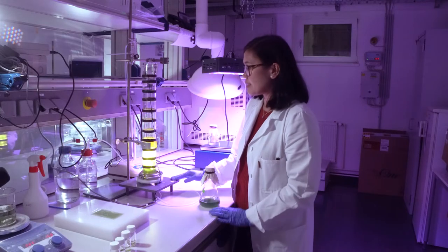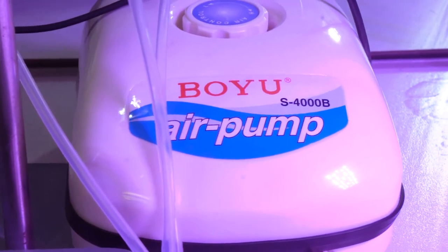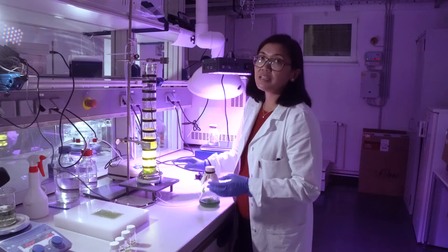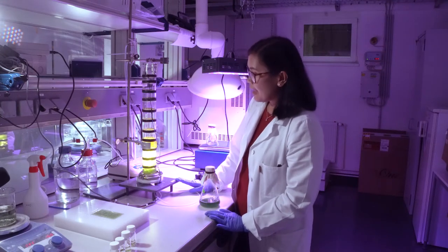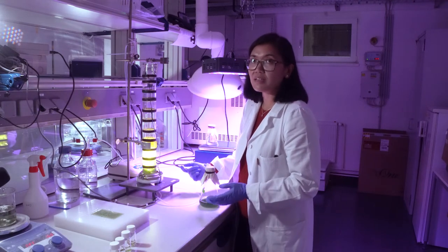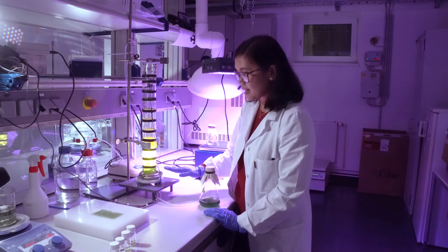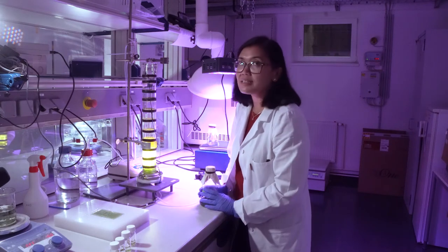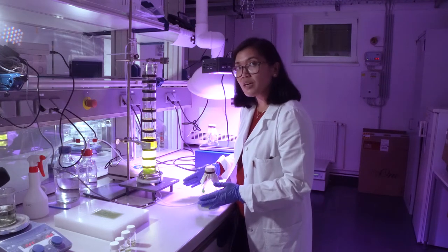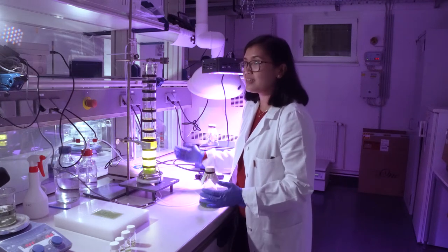The aeration is coming from the air pump here, so it pumps atmospheric air, which cyanobacteria needs for their metabolism — they need carbon dioxide for this. This tube has these coils, which produces electromagnetic force inside the device, and it powers the wireless light emitters that you can see inside. The use of these wireless light emitters is to bring light inside of the reaction mixture, because in the case of a very dense reaction mixture, the light doesn't pass through.